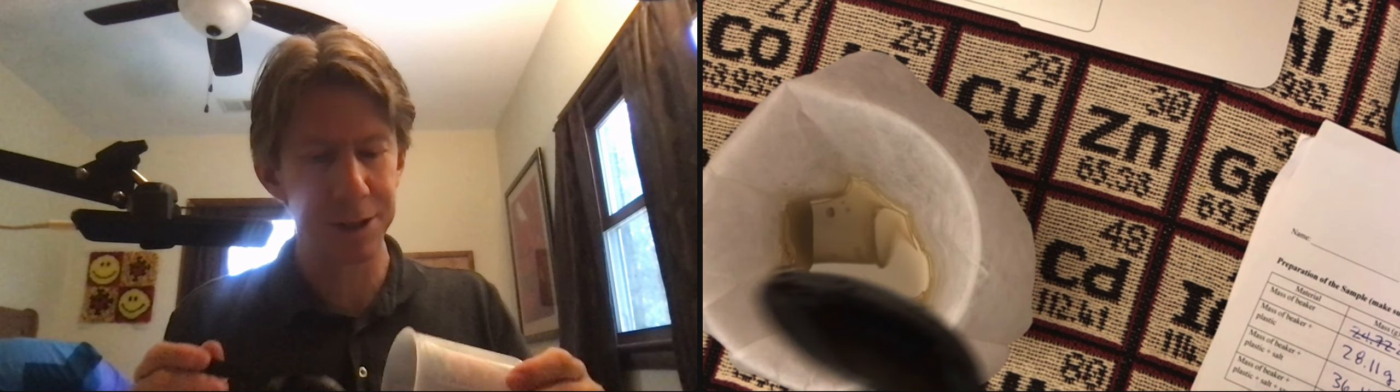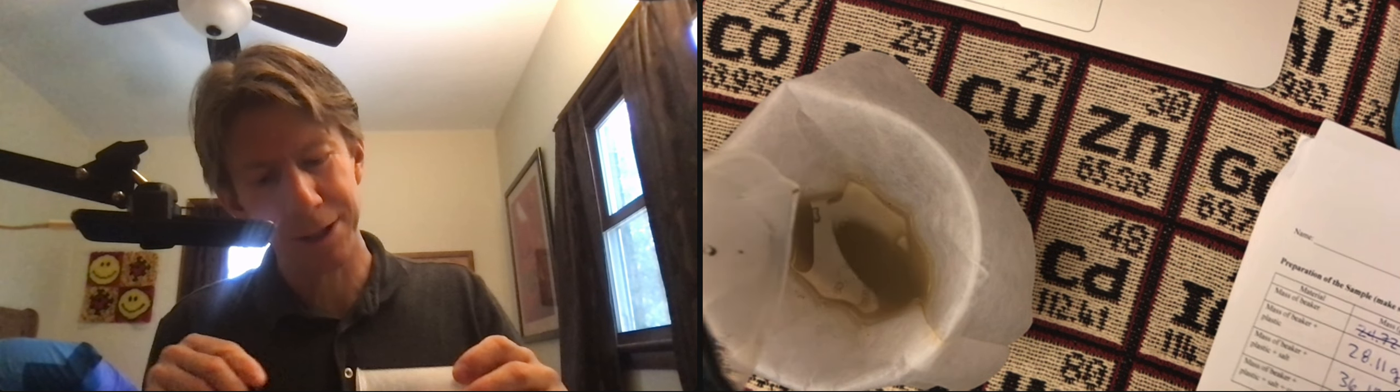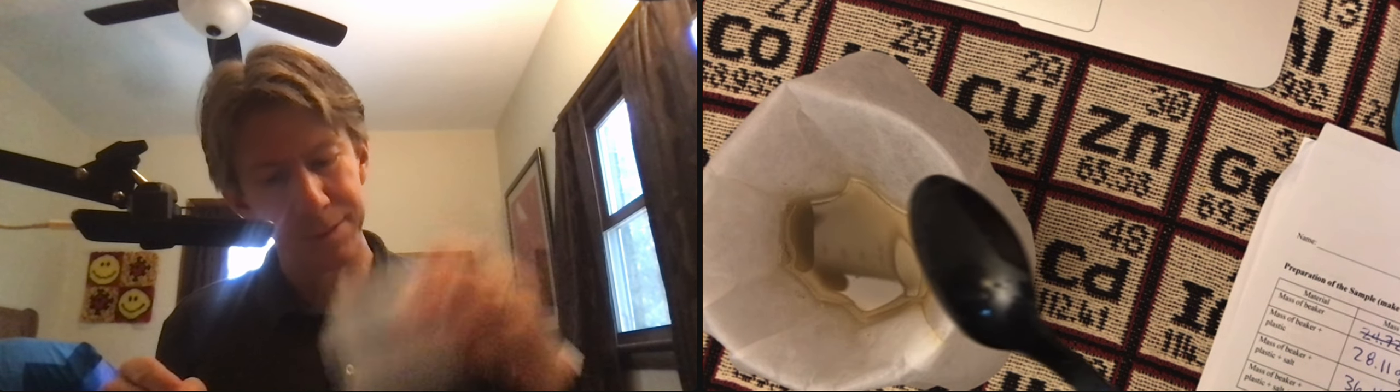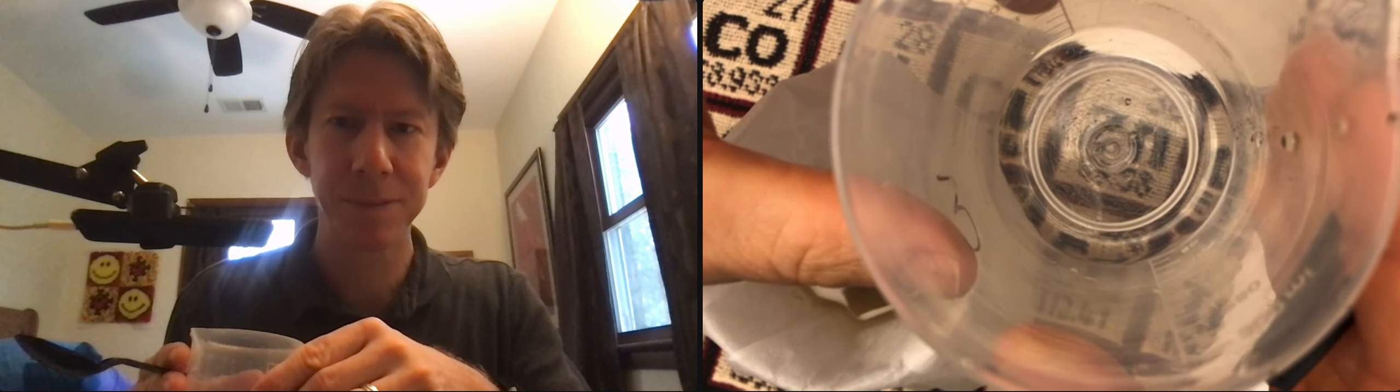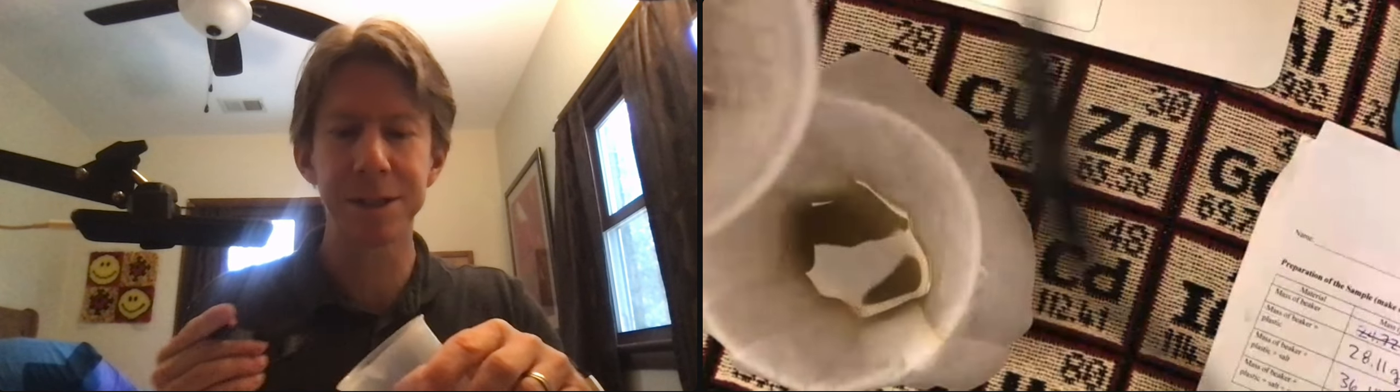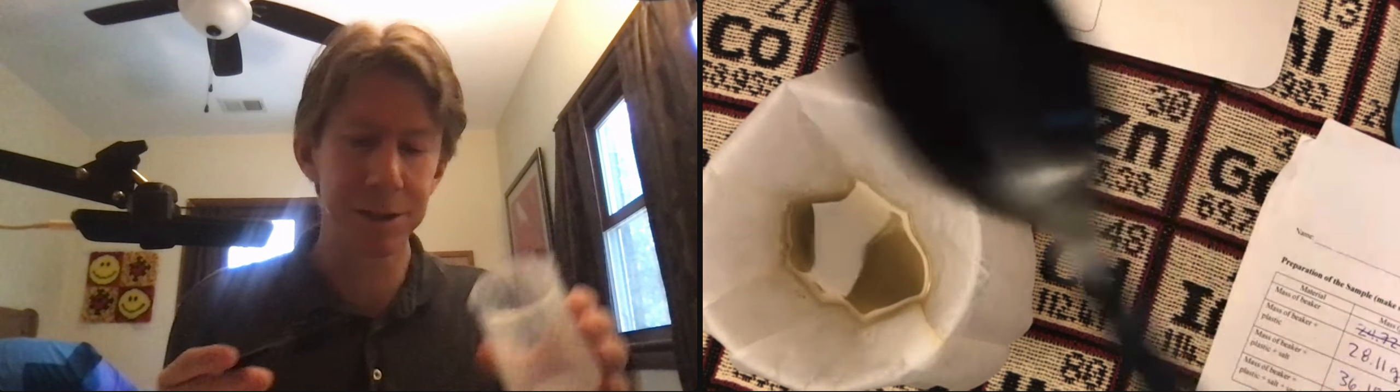Yeah, that's pretty good. So we got a tiny bit right there, but not too bad. Nothing too obvious, except there's a little tiny bit on the edge, but that's going to be a loss for us.